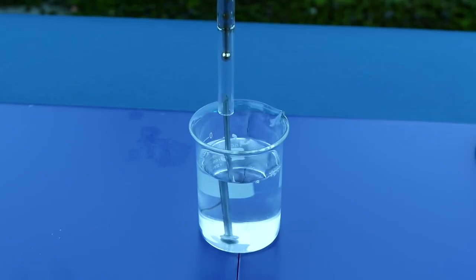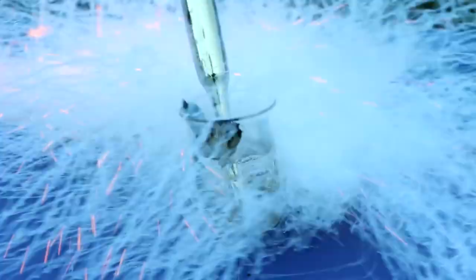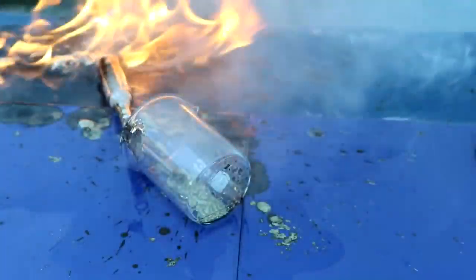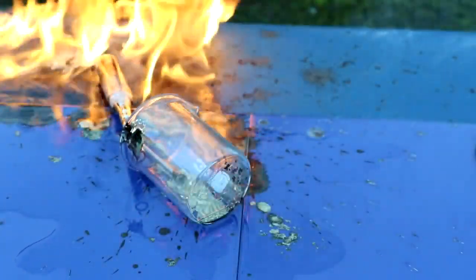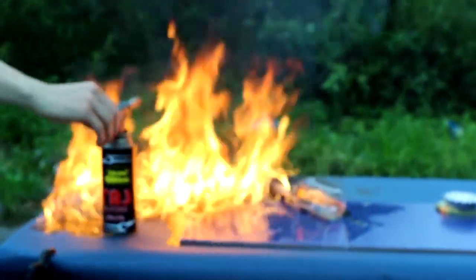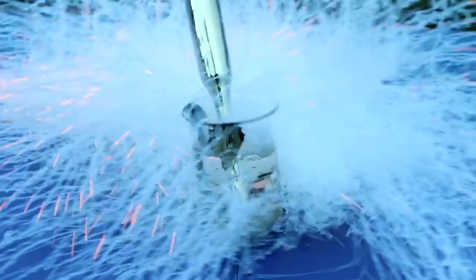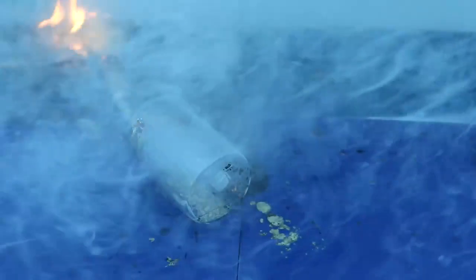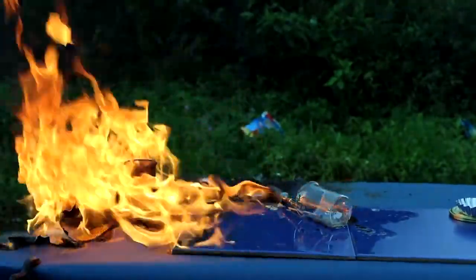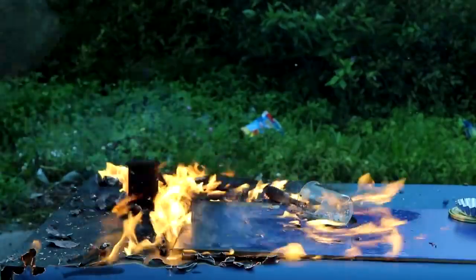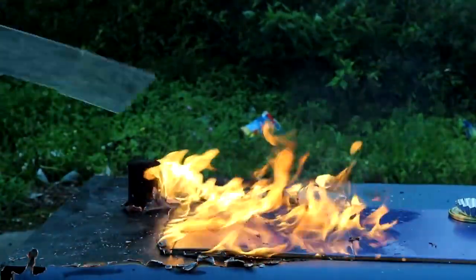However, something went wrong during that part. The liquid cesium instantly ignited in air, burning everything around it. That happened most likely due to the fact that the cesium in the vial was liquid. A water hammer happened, and the top of the vial broke off, pouring cesium onto the table. You can see what happened next. The table is now out of use, but that's okay, we still have more tables.